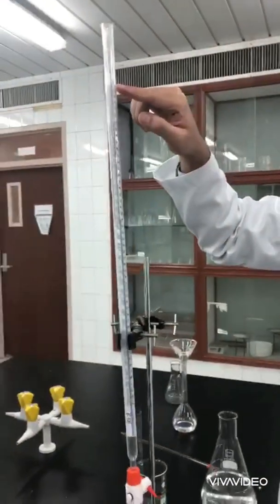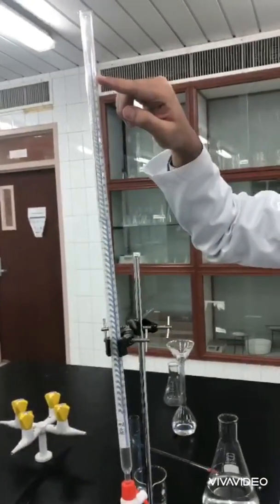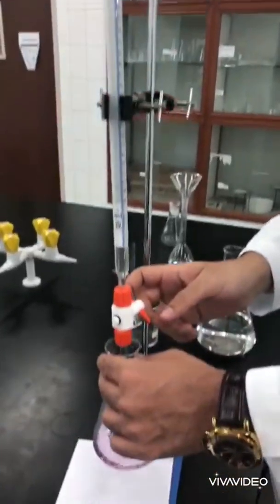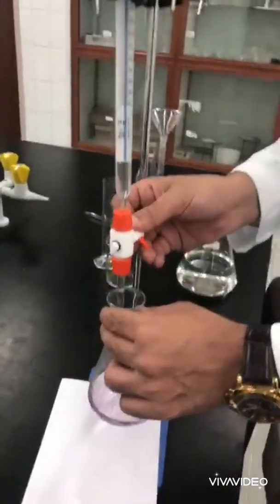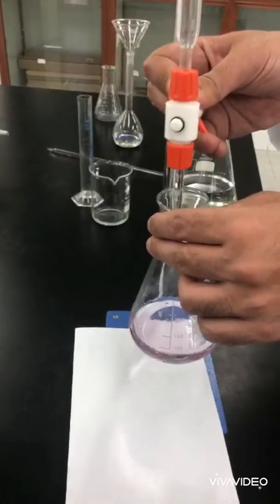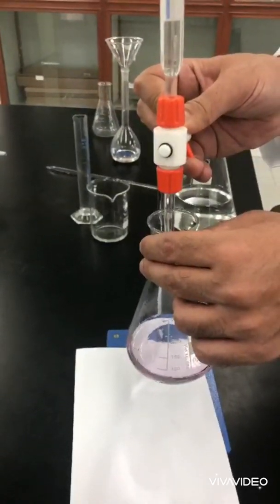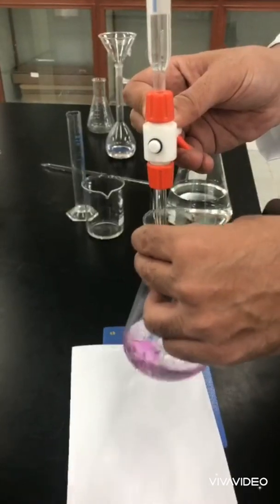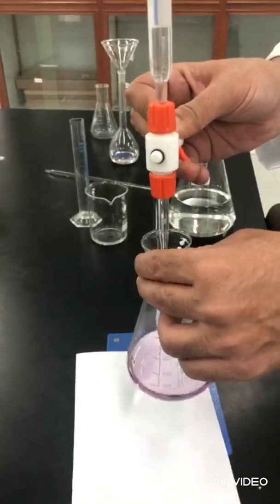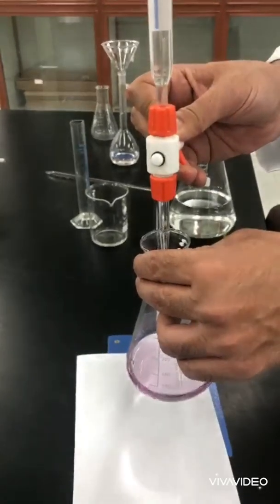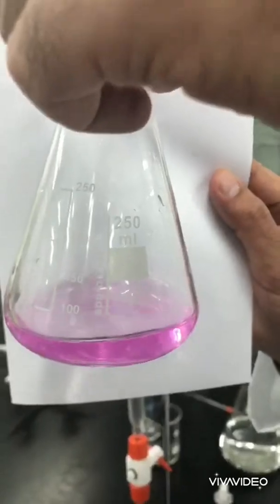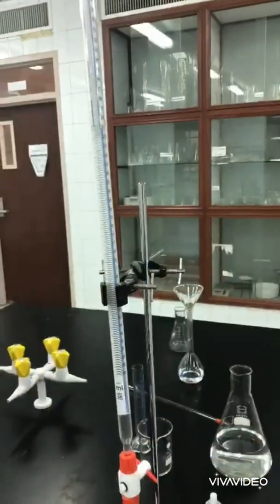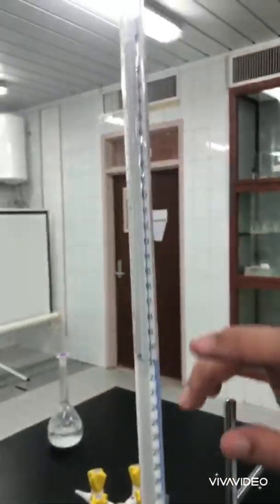I repeated everything. I refilled the burette initially to zero with the standardized sodium hydroxide. Then I started adding sodium hydroxide dropwise. I think I need one more drop, but this time with H2SO4. Yes, that's it. Look at the color.